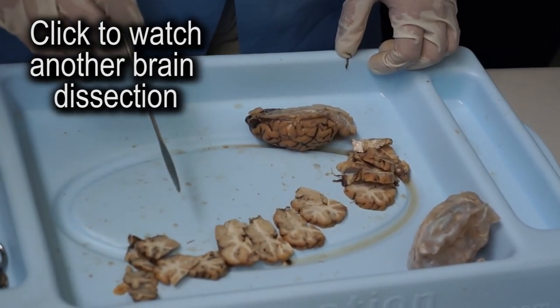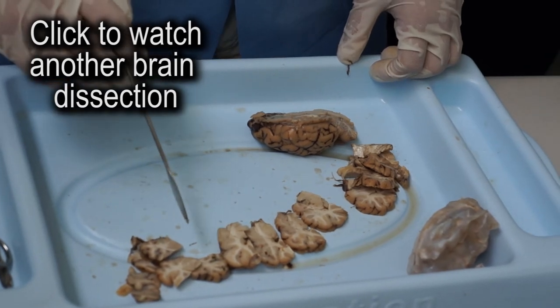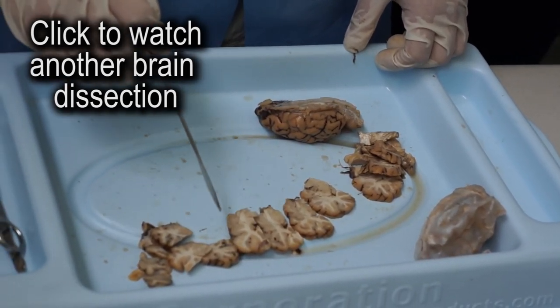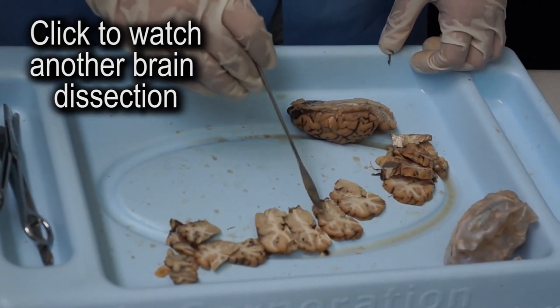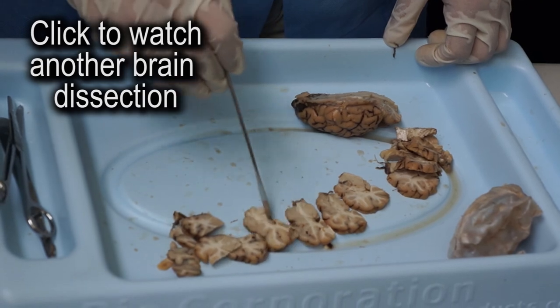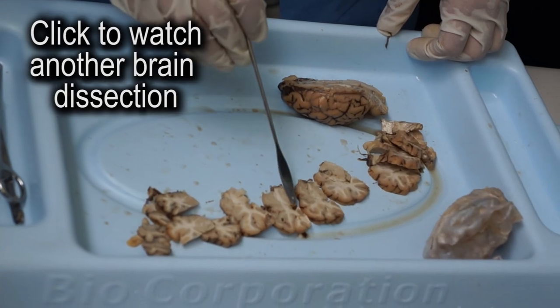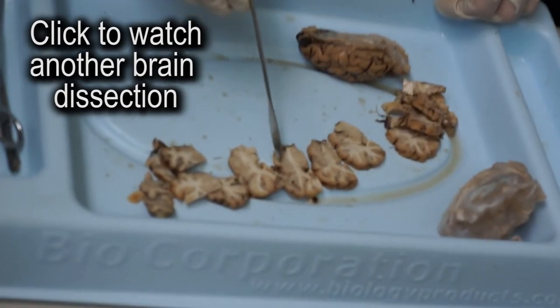Because under that bump will be the hippocampus — the limbic structure. Where is it? There you go. So there you can see a nice, well-defined nucleus. That's a gray matter structure, not a white matter structure.